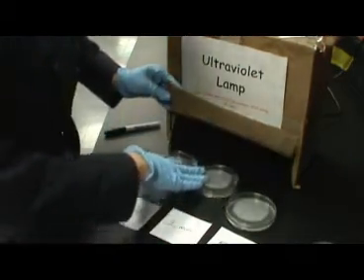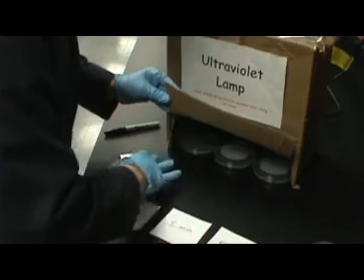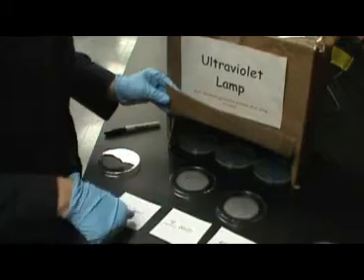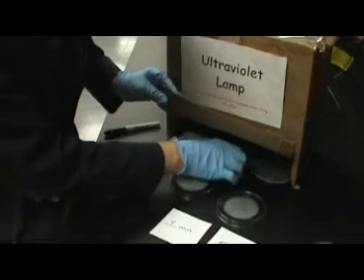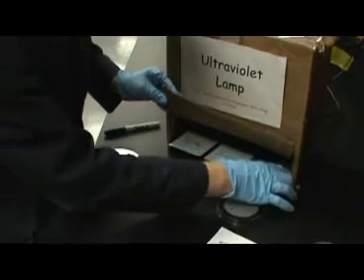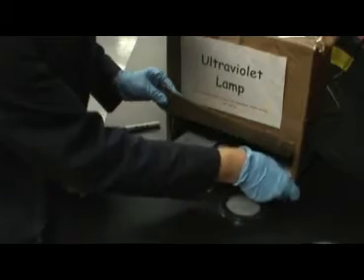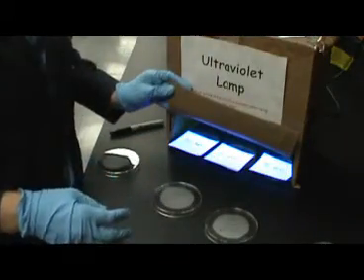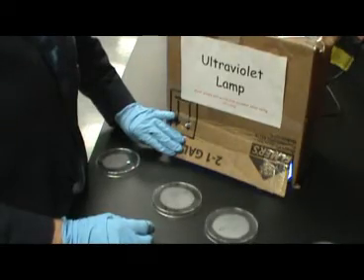Put your plates in front of the UV light. Place all 3 plates in the UV lamp box. Remove the lids. Once the lids have been removed, use index cards to cover half of each of the plates. It is helpful to use index cards that are labeled with the time length that each plate will be exposed: 30 seconds, 1 minute, and 5 minutes. After putting your plates and the cards on top of the plates, turn on the UV lamp. Make sure when handling the plates that you are wearing nitrile gloves and UV protective glasses.